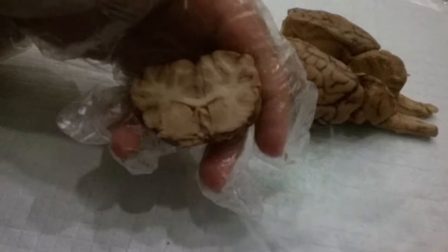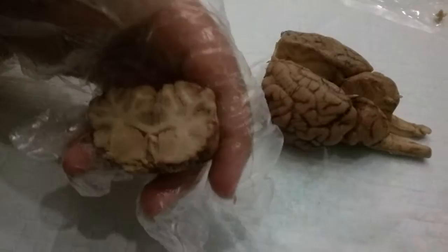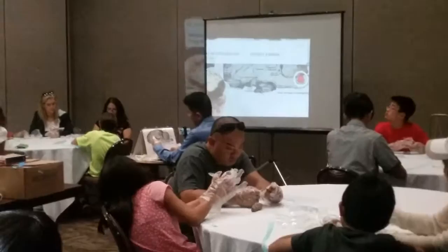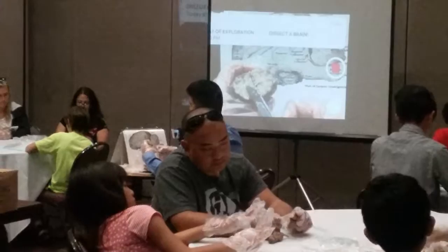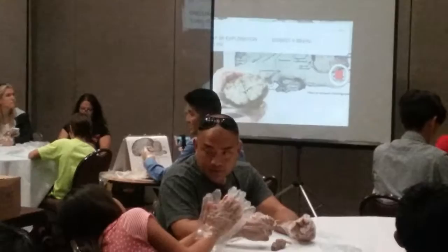If you're studying neurology, there are so many blood vessels you have to learn, and not only are there many blood vessels but there are also variants. Here we're looking at the corpus callosum. Here's the corpus callosum on the cross-section, and you can see the left and right lateral ventricles. Adjacent to that is a lot of white matter, which tends to be damaged in disease processes like multiple sclerosis and other autoimmune diseases.